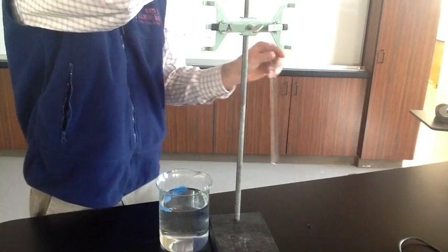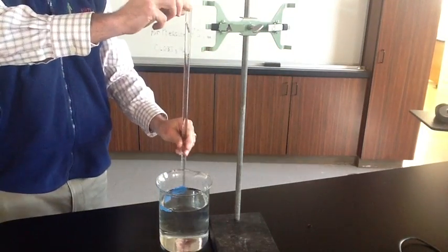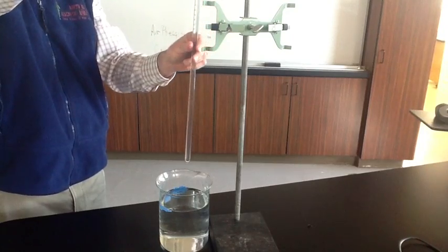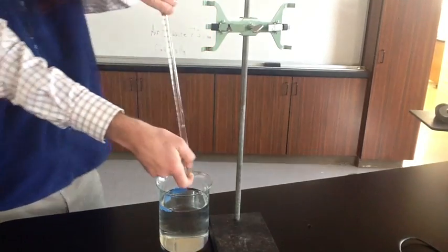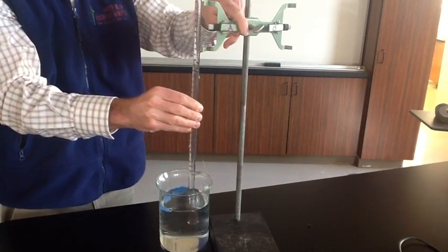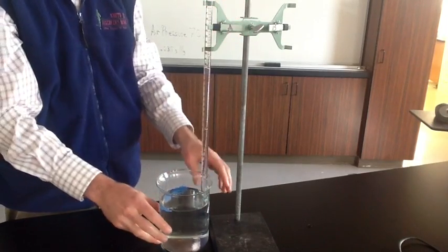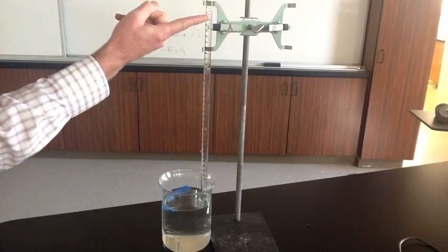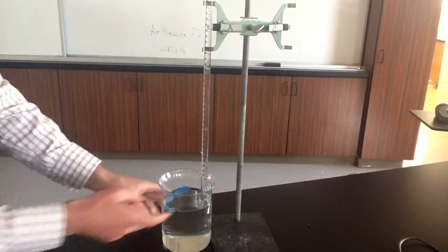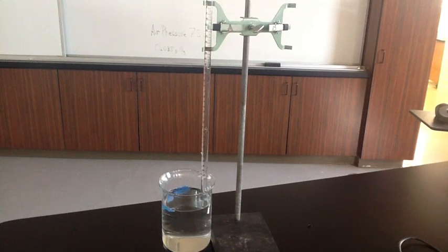Okay, so we have the magnesium ribbon up here at the top. It's in the water right now. The hydrochloric acid is down here in the bottom of the tube. If we flip it over, then the hydrochloric acid will start to mix with the water. So the hydrochloric acid is up here right now. It has a higher density. It's going to start moving down and start mixing with the water and eventually get in contact with the magnesium ribbon at the bottom. And when it gets in contact with that magnesium ribbon at the bottom, it's going to start producing hydrogen gas.